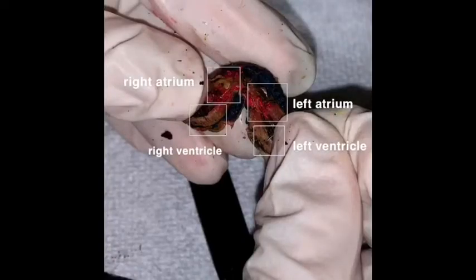Now here we have the inside of the heart, where the two atria and the two ventricles, each on the right and left side of the heart, can be seen. This is where blood travels inside of the heart. Blood is pumped into the right atrium and down to the right ventricle. From there, it goes to the lungs to pick up oxygen and is deposited back into the left atrium. Then it is pumped down to the left ventricle before the aorta pumps it back into the rest of the body.